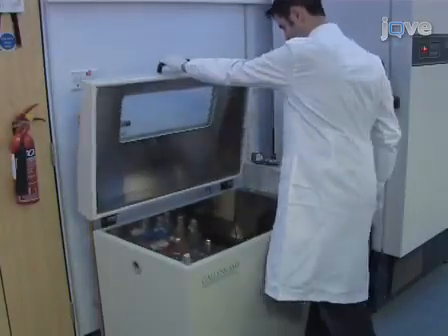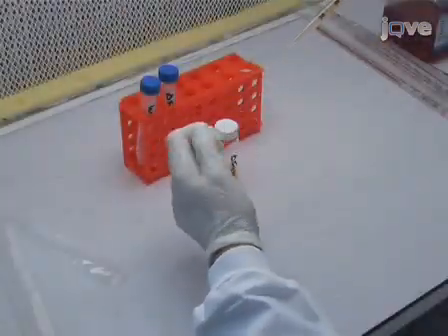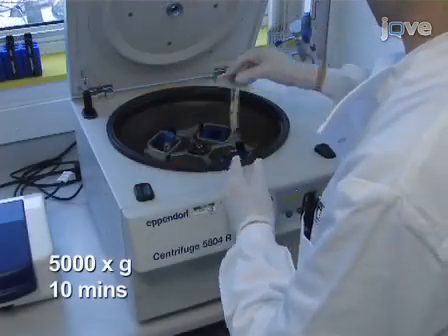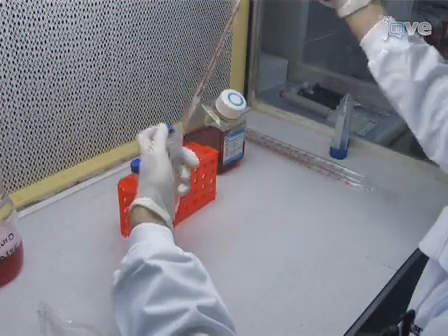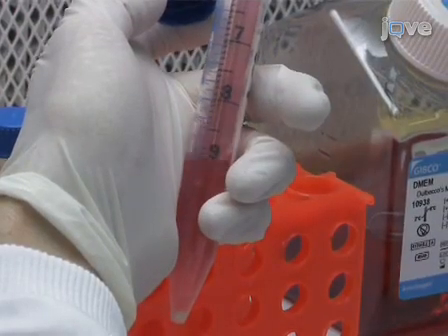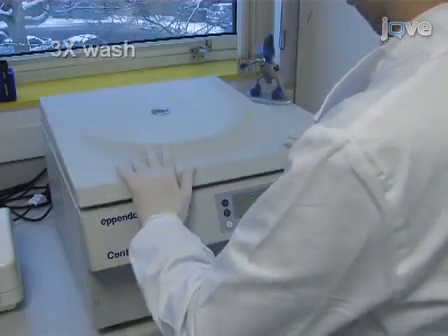Prepare a 10 ml culture of Staphylococcus aureus in brain-heart infusion broth. Transfer the bacterial culture into a conical tube and centrifuge the bacteria at 5000 times G for 10 minutes. Once the cells have been pelleted, remove the supernatant and resuspend the pellet in 10 ml of sterile DMEM to wash the cells. Centrifuge the cells once more and repeat the wash 3 times.